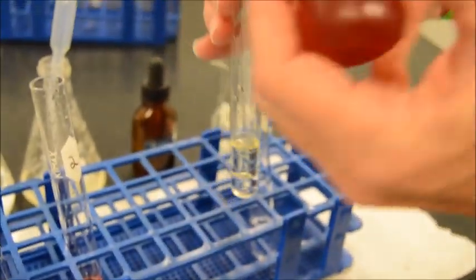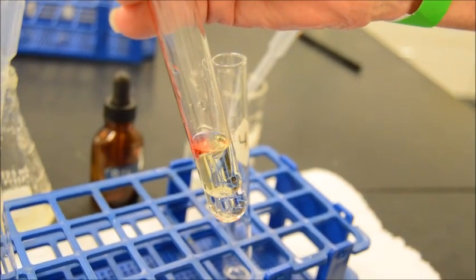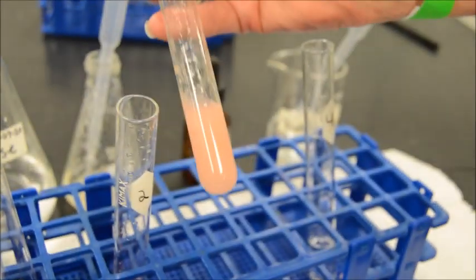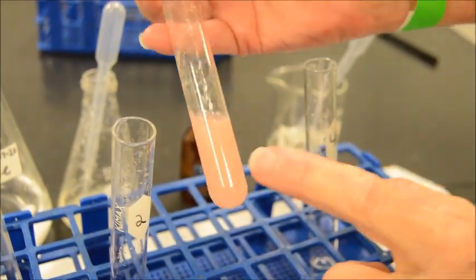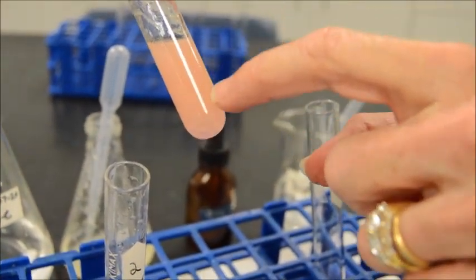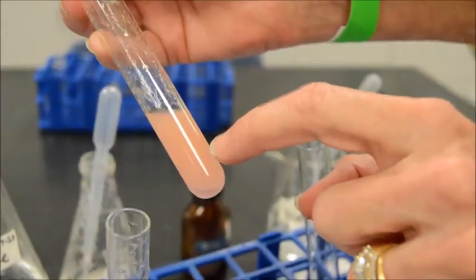Okay. All right, next, so now we're to our oil. All right, so 1, 2. Okay. All right, so good shake here, just like you'd shake up salad dressing. And we end up with this kind of a milky coloration. So you can see still the pinkish reddish color, but can you start to see the separation? There are little bubbles here that we can tell that the oil, just like in salad dressing, how you have oil and vinegar. It's looking real clear there on the bottom.